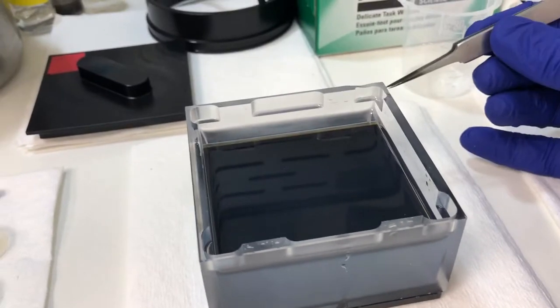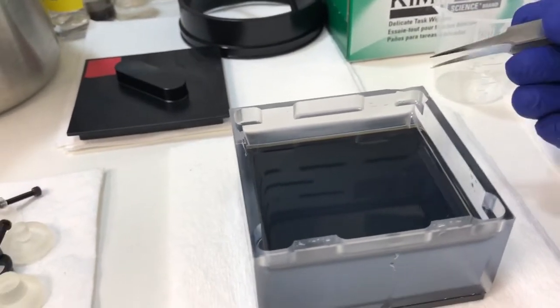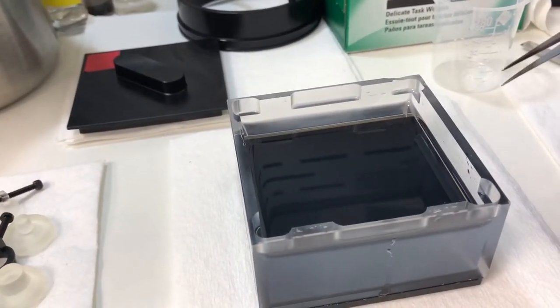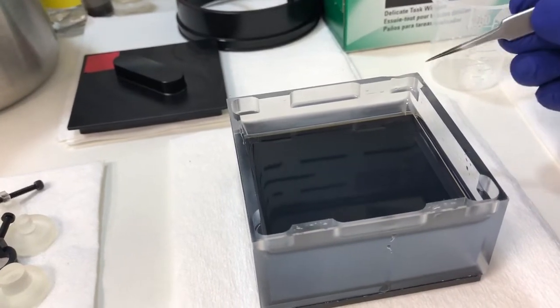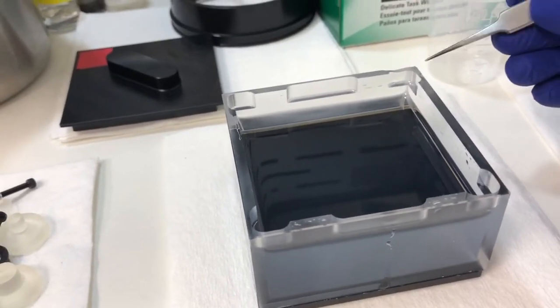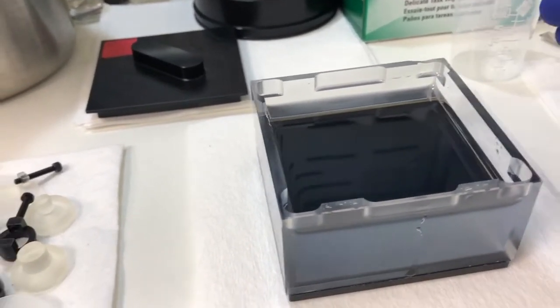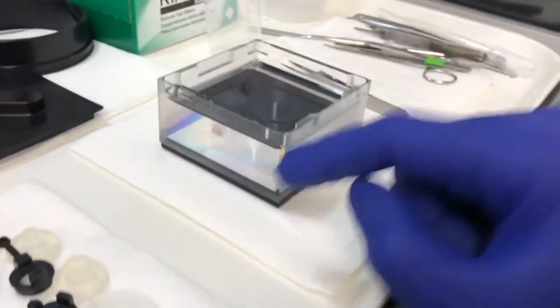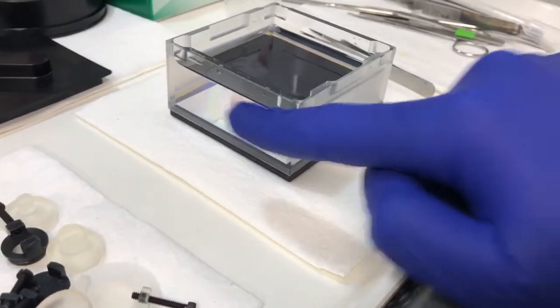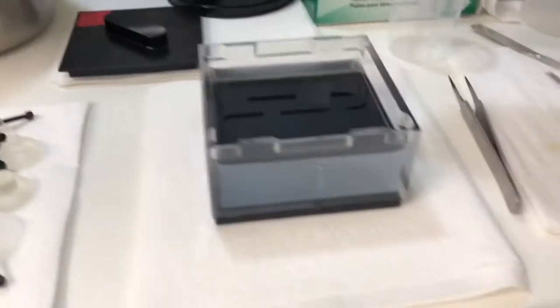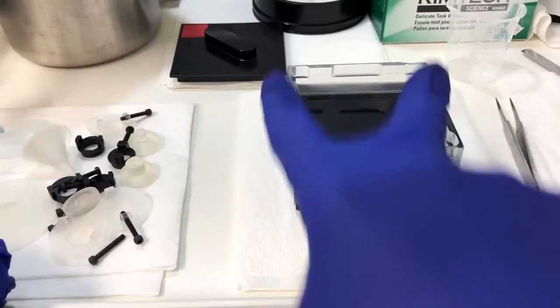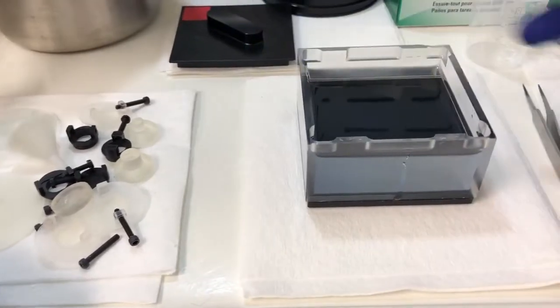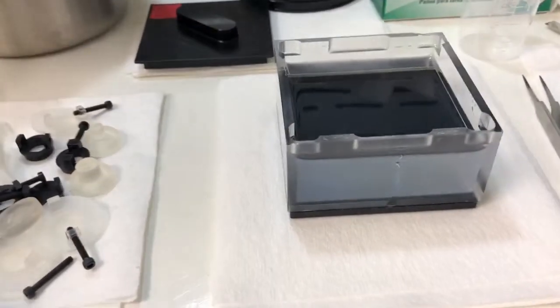Another thing is this cuvette - I've managed to damage it in this corner. I bumped it into one of the big DBE bottles at some point. This corner, the damaged corner, unfortunately should always be pointing to the top right. The cuvette has a frosted side and a clear side, so there are two clear sides and two frosted sides. Obviously the light sheet goes from clear side to clear side.